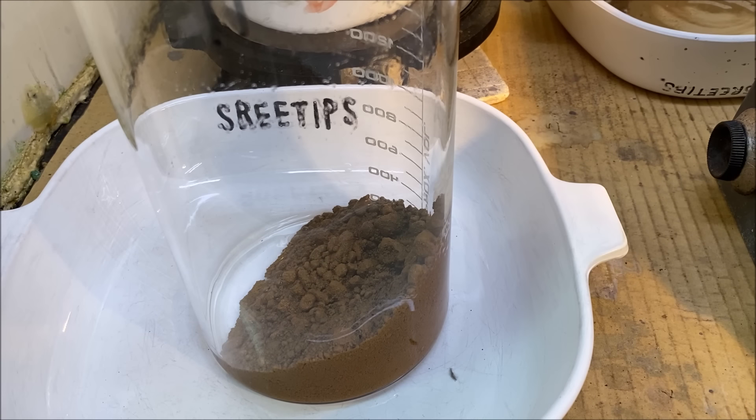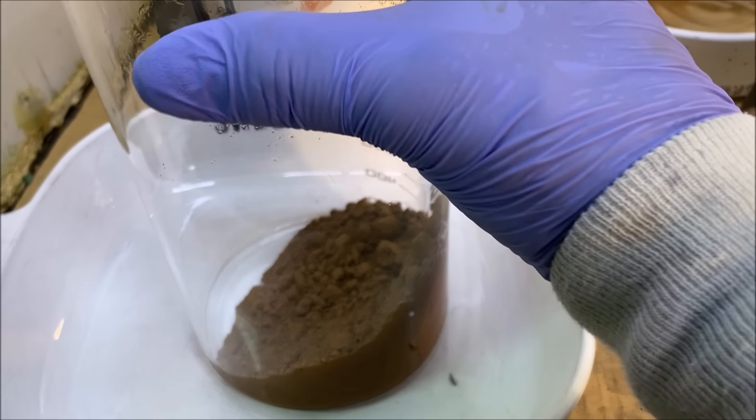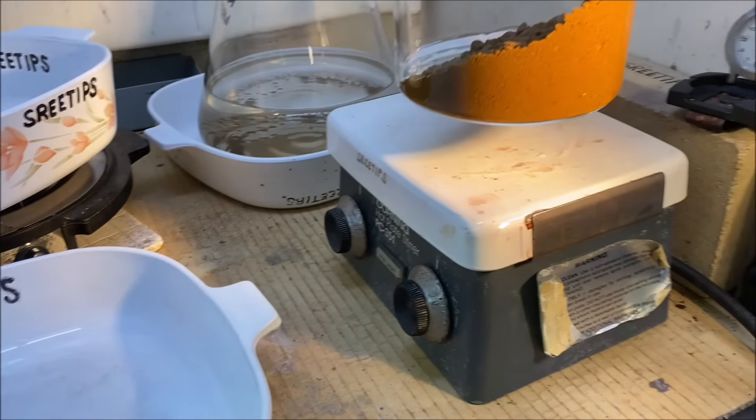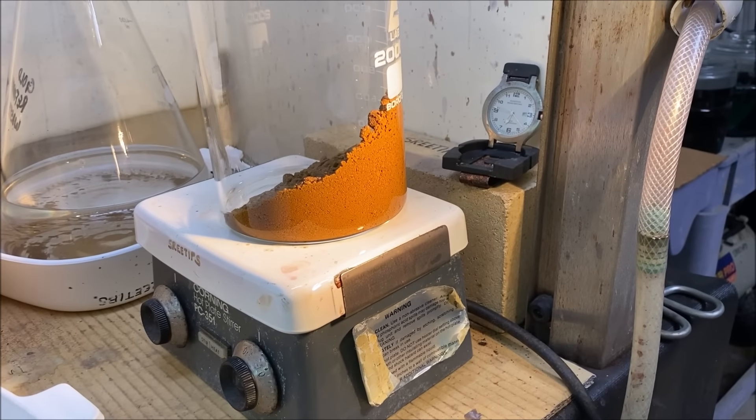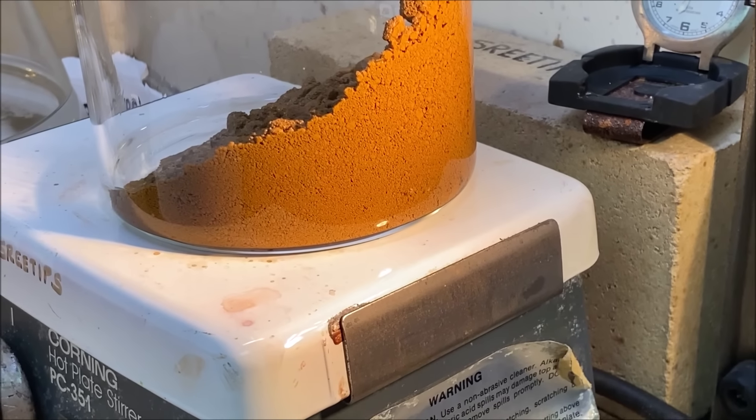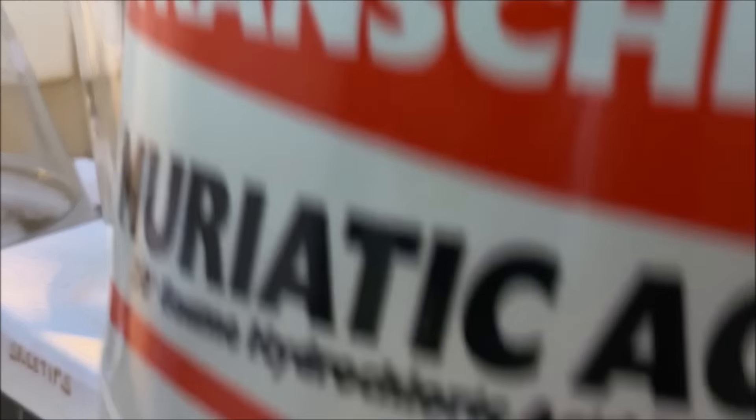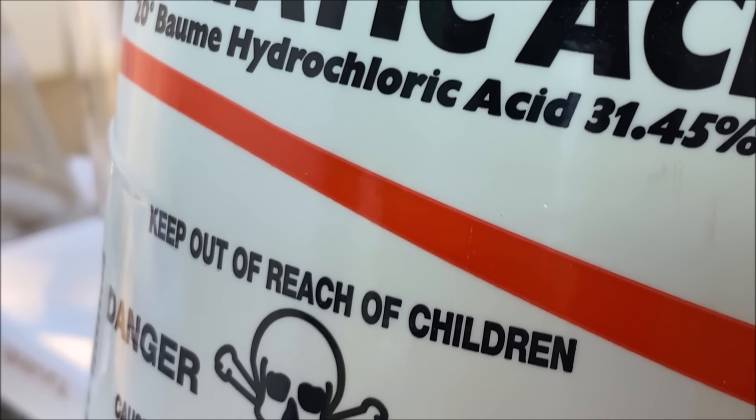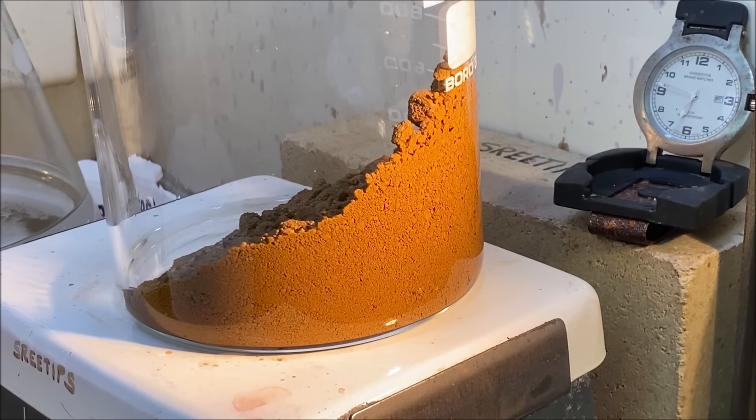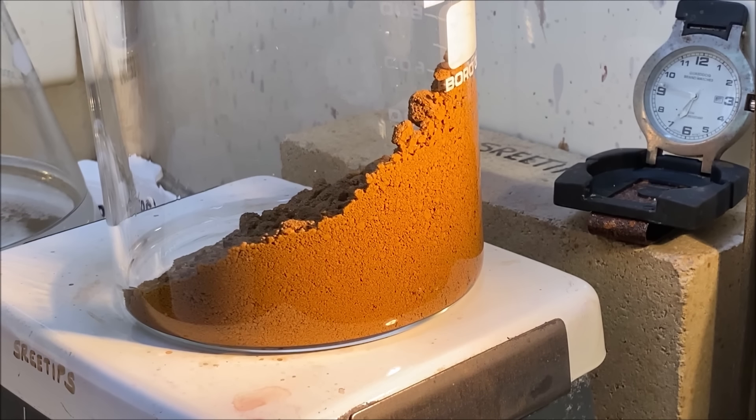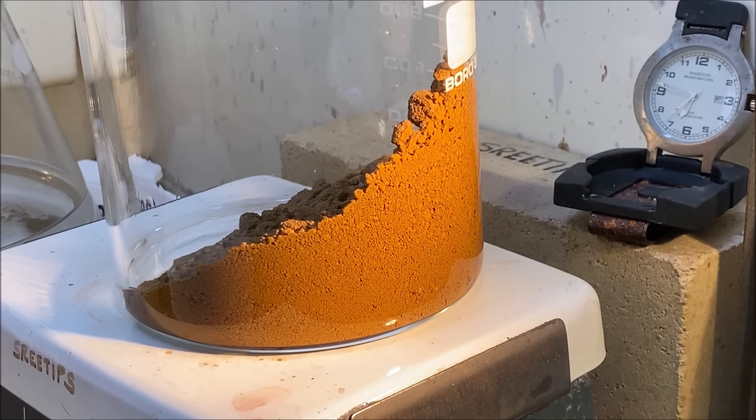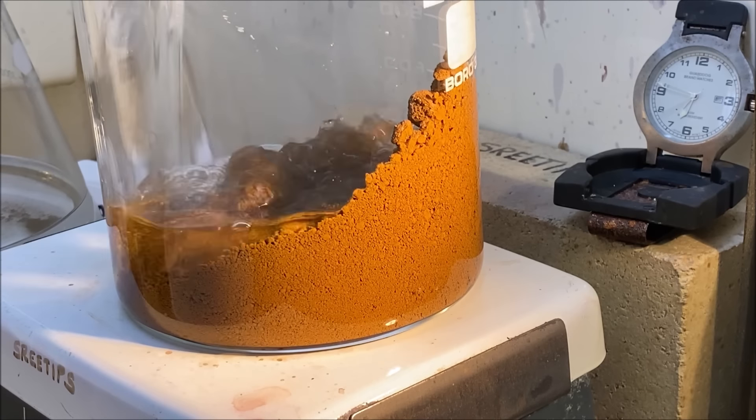Here's our gold. There's about six ounces in here. I'm going to set it up here on our heating pad. And now what we'll do, adding some hydrochloric acid. I'm going to fill this up to about the 800 milliliter level in hydrochloric acid.